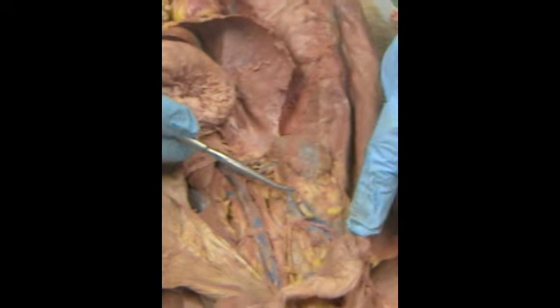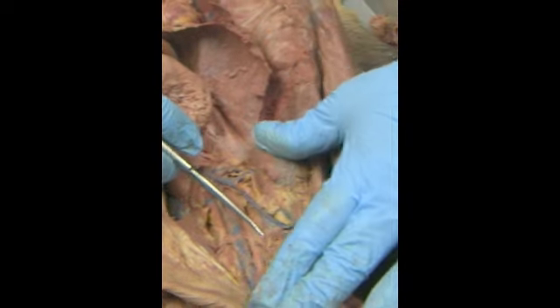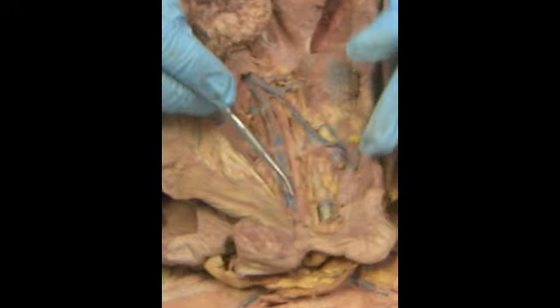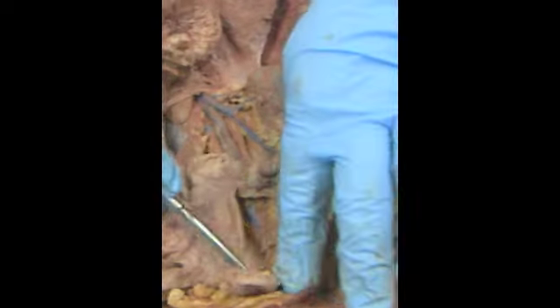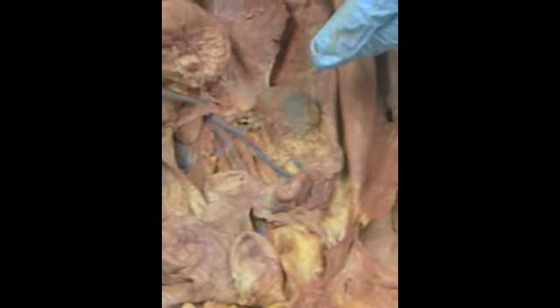If this is a female, it would be ovarian. Okay? The artery joins it right here. As we go down further, we're going down the inferior vena cava. Because it's a female, we're going to have some difficulties to see things. It will then split. We will have the common iliacs. Deep below the urinary bladder, we'll have one coming in, which is the internal iliac vein, and then the external.